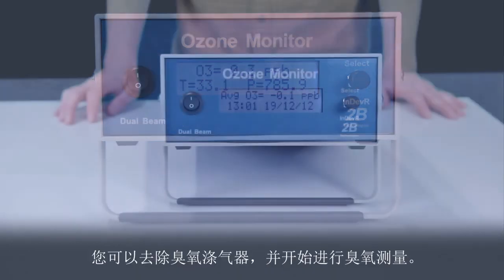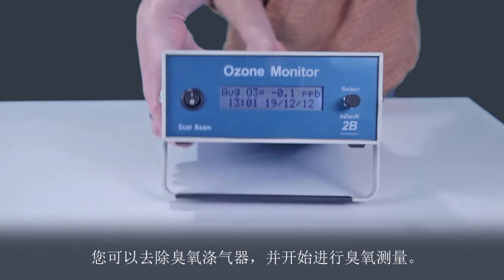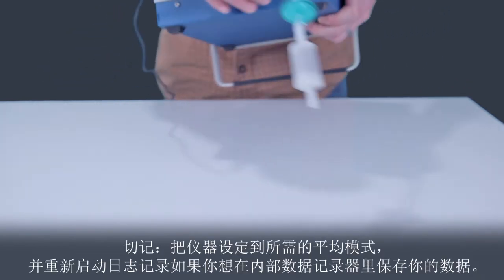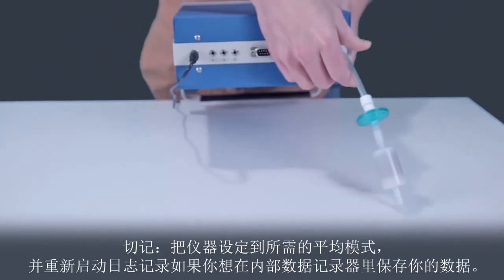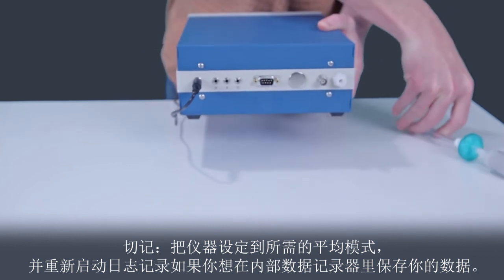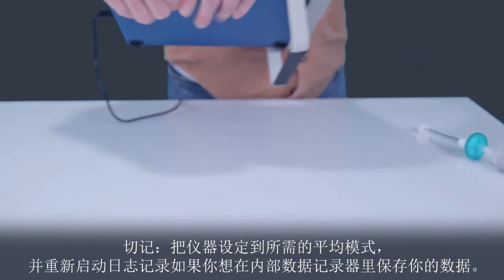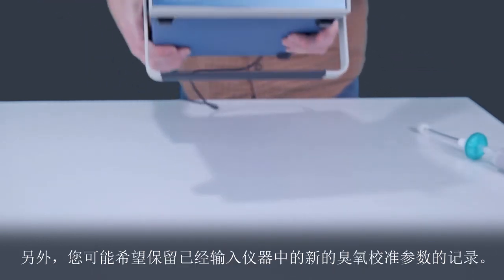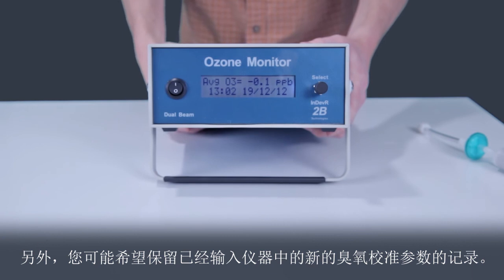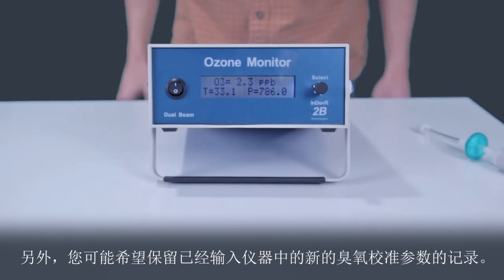You can remove the ozone scrubber and begin ambient ozone measurements. Be sure to set the instrument to the desired averaging mode and restart logging if you want to save your data in the internal data logger. Also, you may want to keep a record of the new ozone calibration parameters that are entered in the instrument.